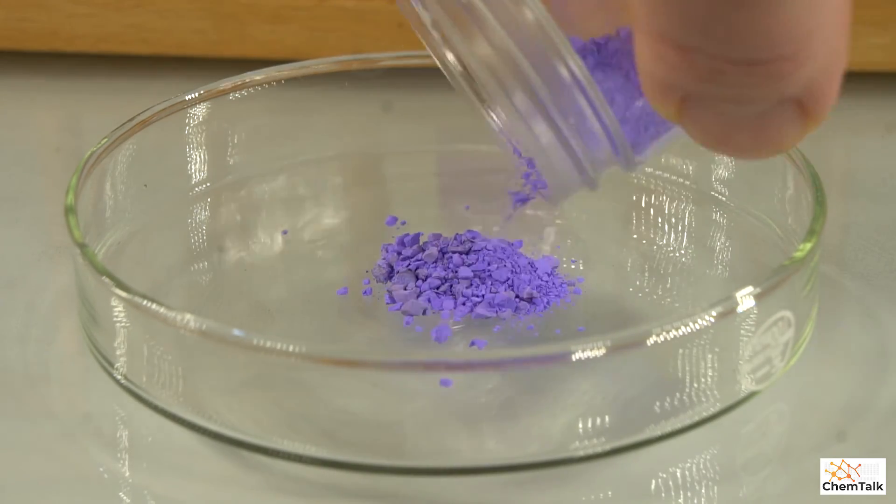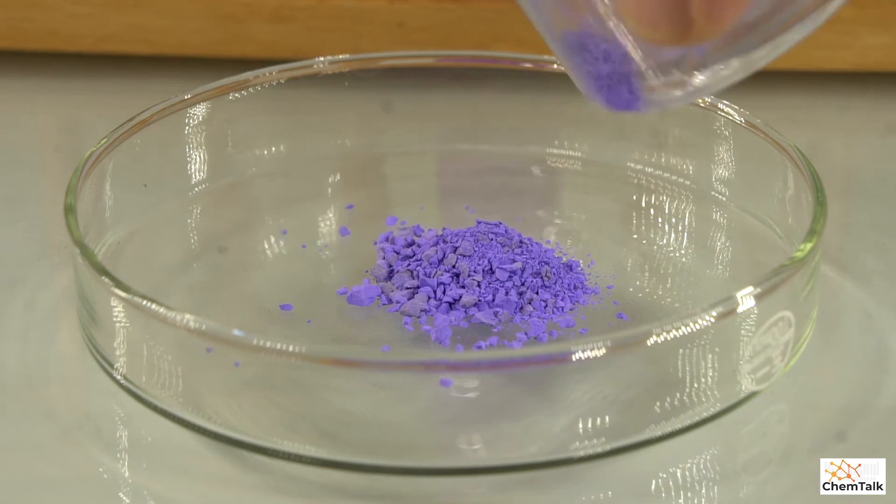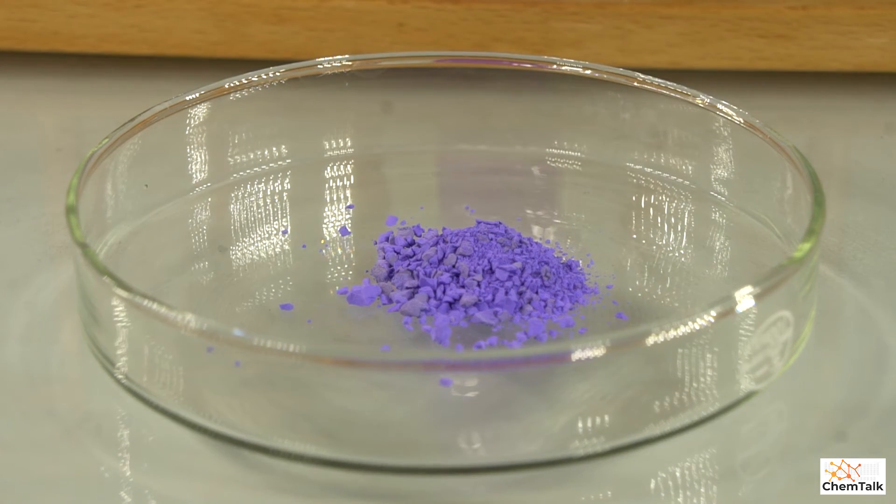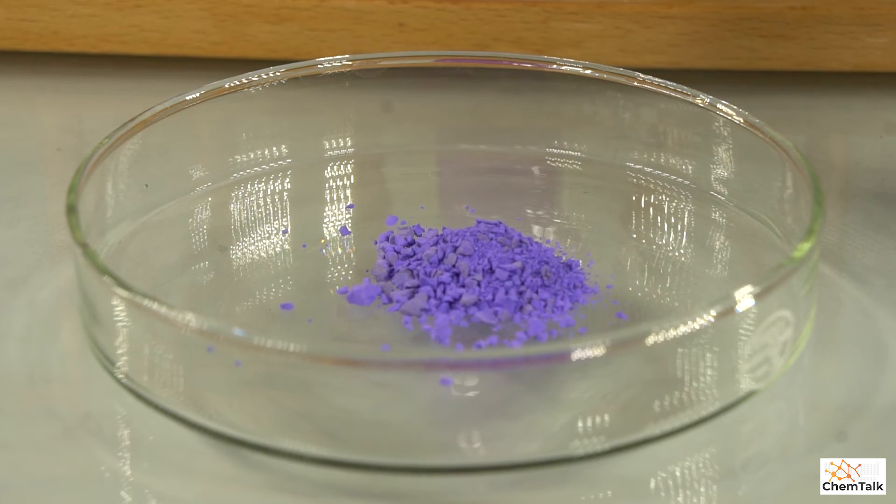It dries out really nicely. And the great thing is you can add this to your compound collection and we're going to find a way to reuse this in later experiments.